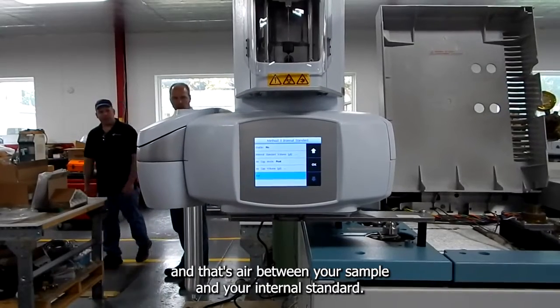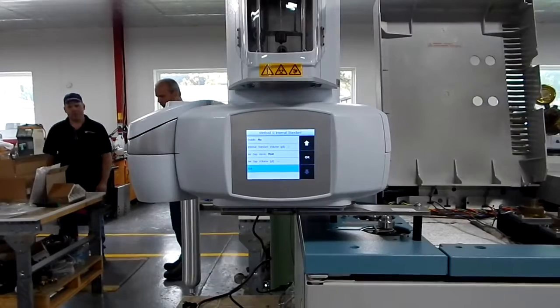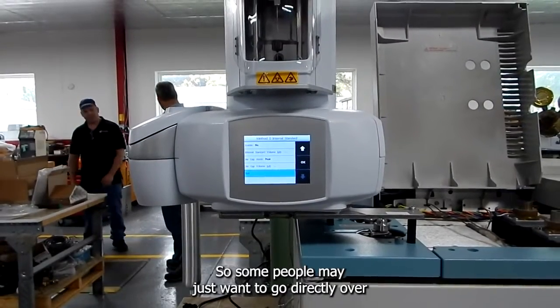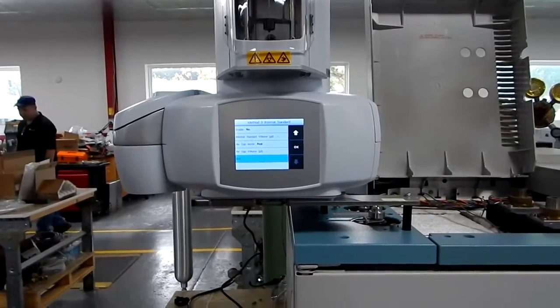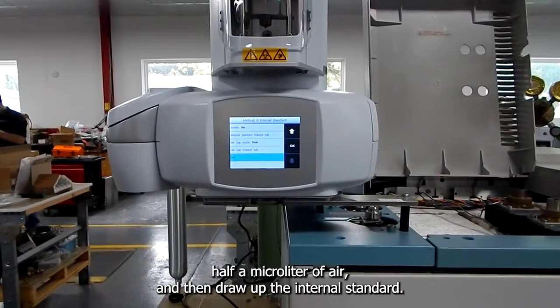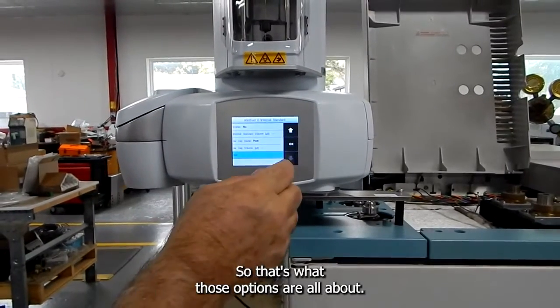And that's air between your sample and your internal standard. So some people may just want to go directly over. Some people may want to draw up sample, draw up half a microliter of air and then draw up the internal standard. So that's what those options are all about.